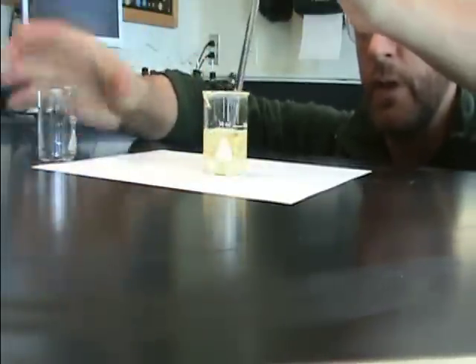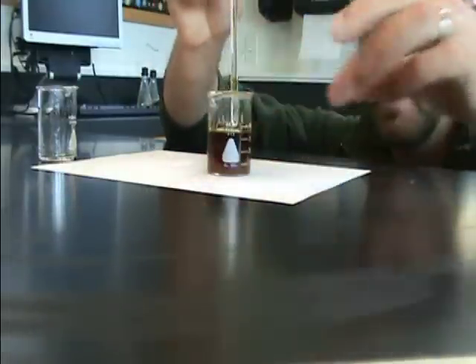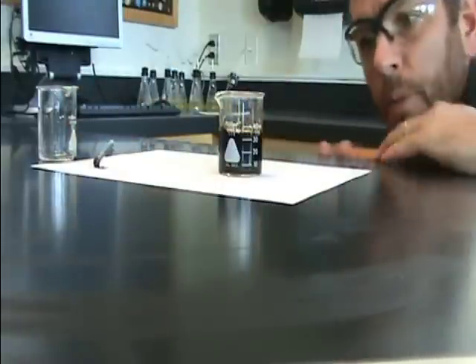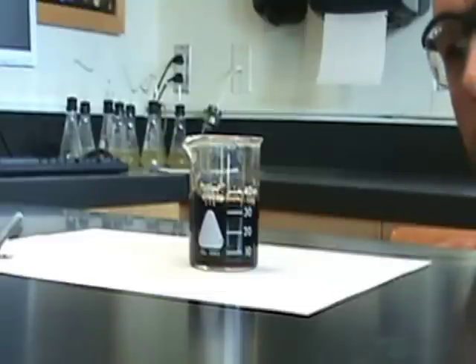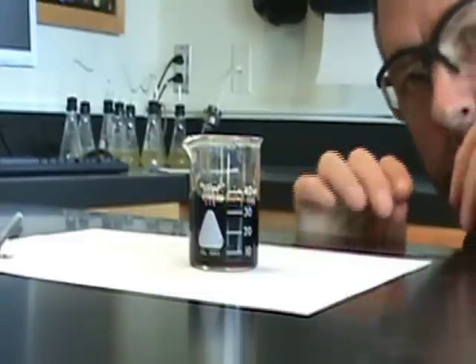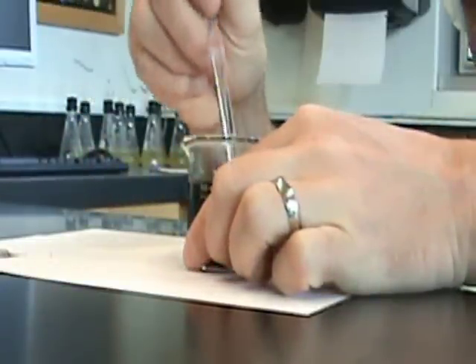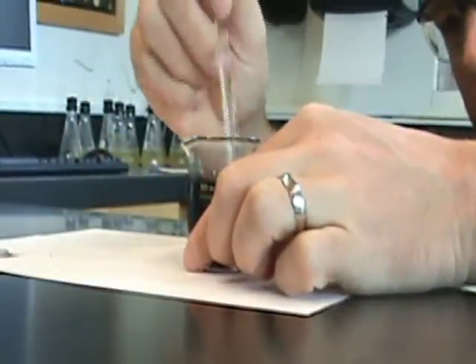I'm going to just give it a stir. You can see some action already. Now what's happening is the sugar molecules are actually breaking apart. We have the atoms of the sugar — the carbons, the hydrogens, the oxygens — separating from each other. As that happens, different substances are going to form. It takes a little bit to get going.